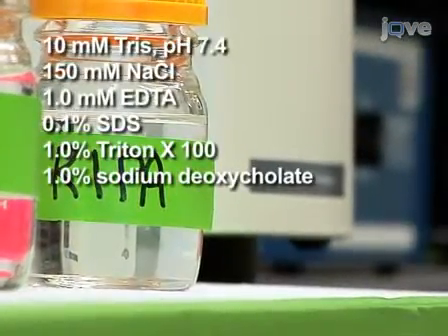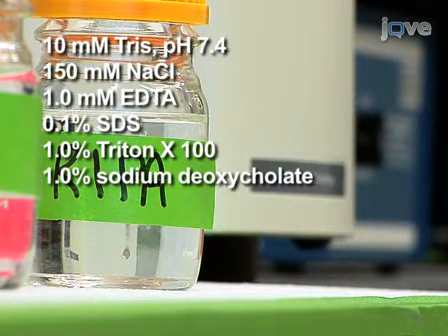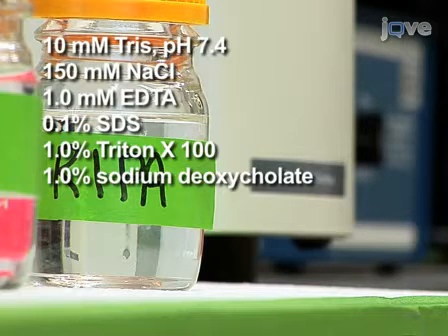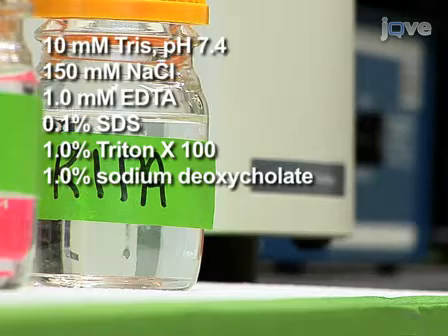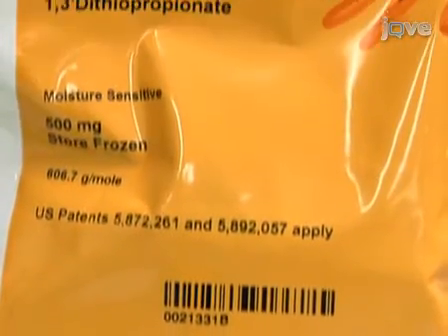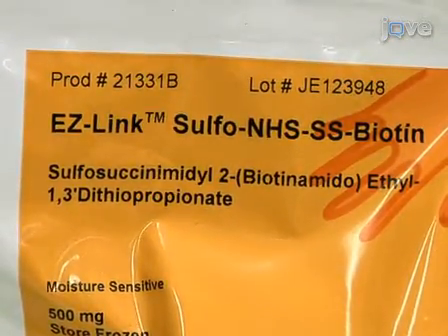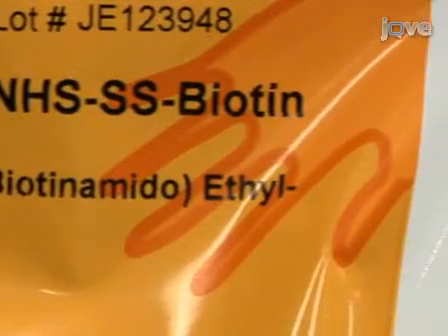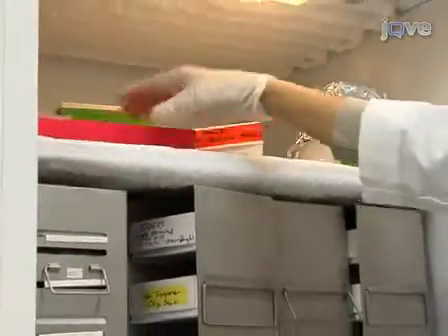RIPA buffer is prepared using 10 millimolar tris at pH 7.4, 150 millimolar sodium chloride, 1 millimolar EDTA, 0.1% SDS, 1% Triton X-100, and 1% sodium deoxycholate. Next, prepare sulfo-NHS-SS biotin stock solution by dissolving in dimethyl sulfoxide (DMSO) to a concentration of 200 milligrams per milliliter. Prepare 500 microliter aliquots and store at minus 20 degrees Celsius.